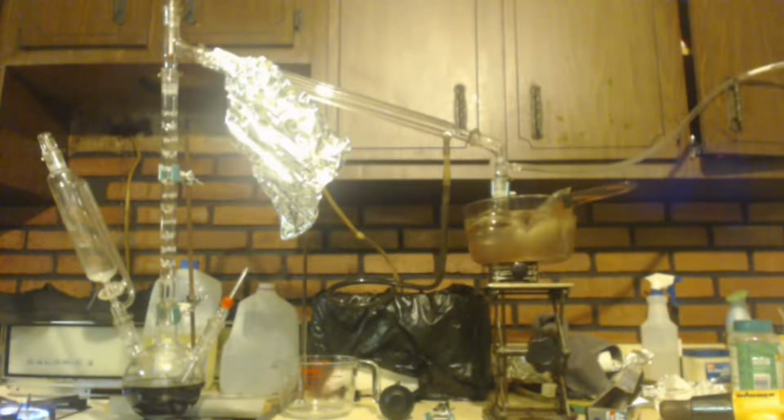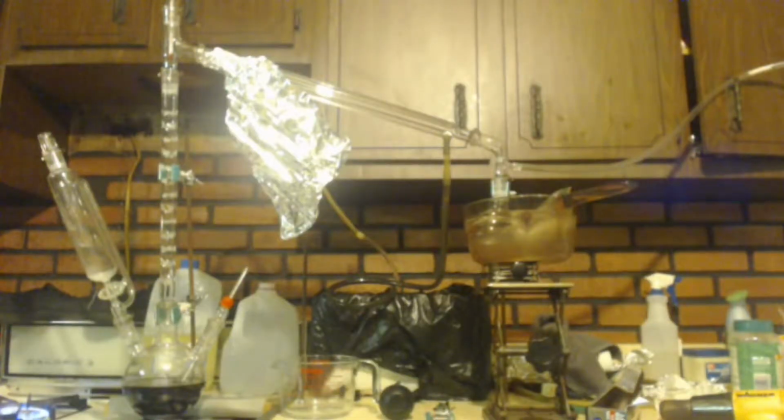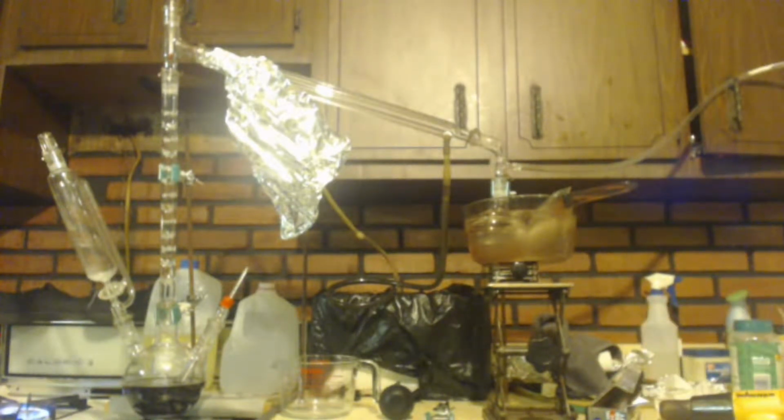We're making sodium propanoate. In the last video, I was putting some hydrochloric acid, a third of a mole, into my product, the stuff that I made, to quench it. And when I did that, I wasn't thinking it's going to produce hydrogen. The hydrogen tries to escape and it takes some of the HCl with you, so I'm getting sprayed with that.